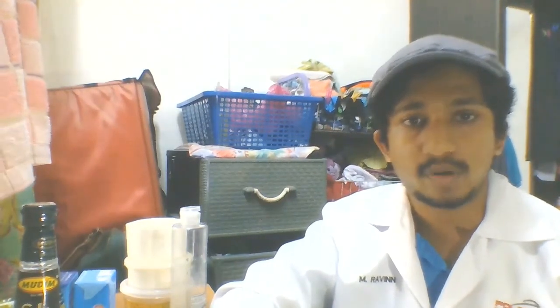For this lab, I'll be conducting the precipitation of casein from milk. Casein is the main protein of milk and makes up about 80% of our total milk protein. Casein is very useful for human life, both as an ingredient in the manufacture of food and non-food products, such as making cheese, bread, glue or bioplastic, and others.